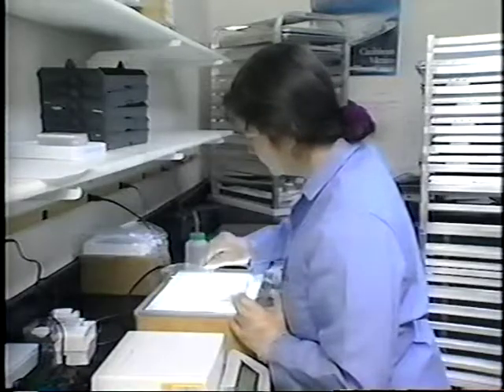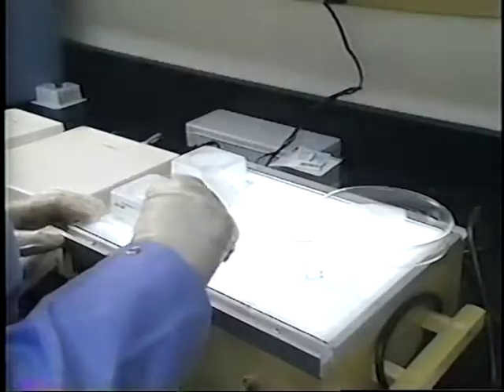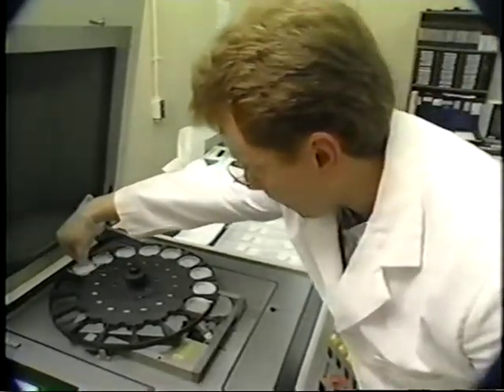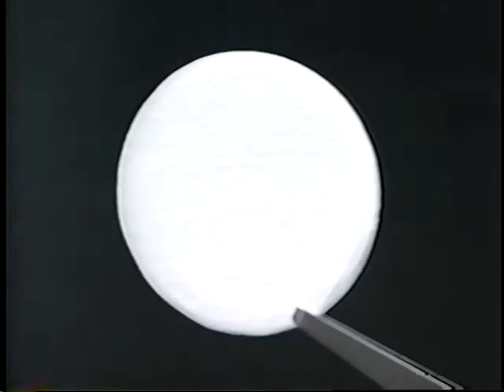Each Teflon membrane filter needs to be individually examined for discoloration, pinholes, creases, separation of ring, chaff or flashing, loose material, or other defects. The filter should be rejected if it fails acceptance testing. In addition, any sets of Teflon membrane filters which exceed 2 times the X-ray fluorescence detection limits for elements are rejected. The second type, quartz fiber filters, adsorb organic vapors over time.